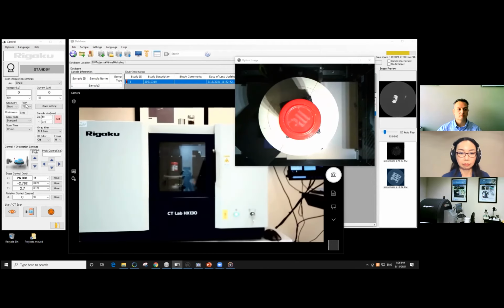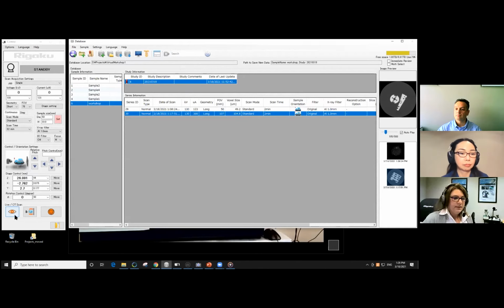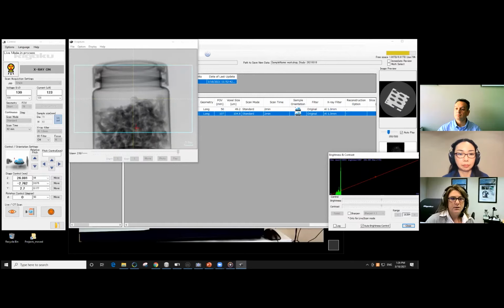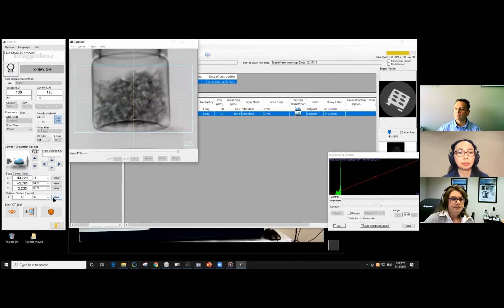Make sure I put my camera back in the right place. And we definitely want to make sure we're centered. So we're going to go to live mode. So, yep. It's just asking me to confirm my dimensions since we changed it from a larger to smaller field of view. Normally, you would measure your sample, you would enter those parameters, and away you go. So here, what we see is our clove bottle. I'm just going to raise it up a tad. Make sure we get lots of cloves in the field of view.